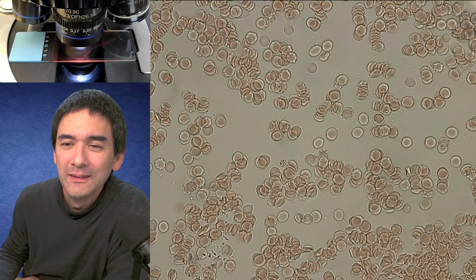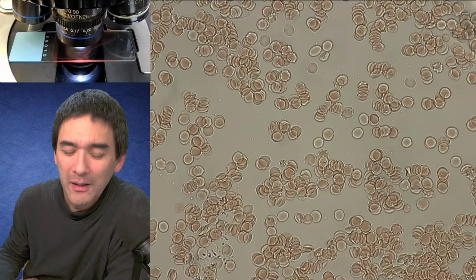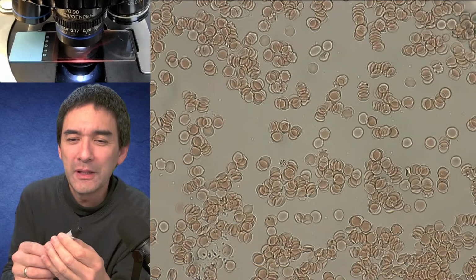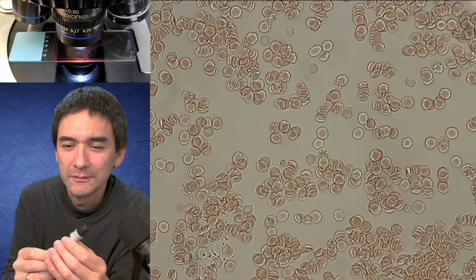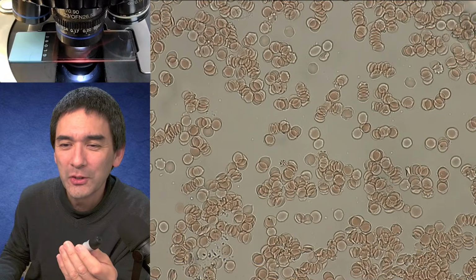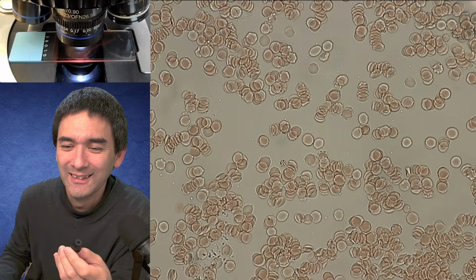So here. Okay, here it is. The comments are about the spring loading here, right? Load the spring, pull back, and then you have to push it. I didn't read all of these comments here. Too much, dial it back. Okay, so maybe I did push it in a little bit too much.